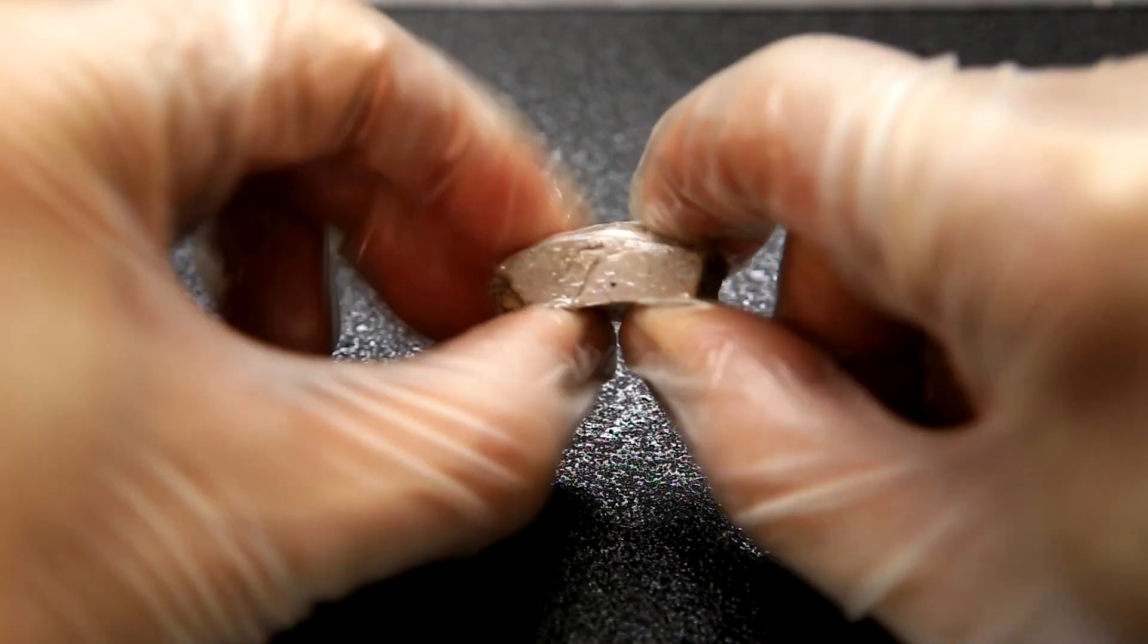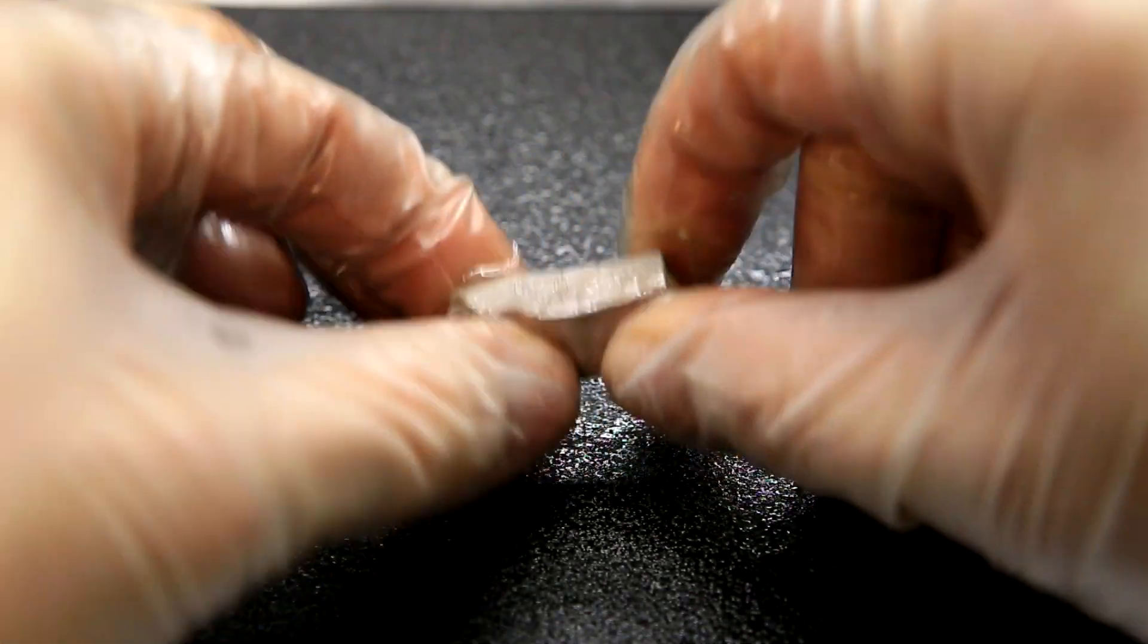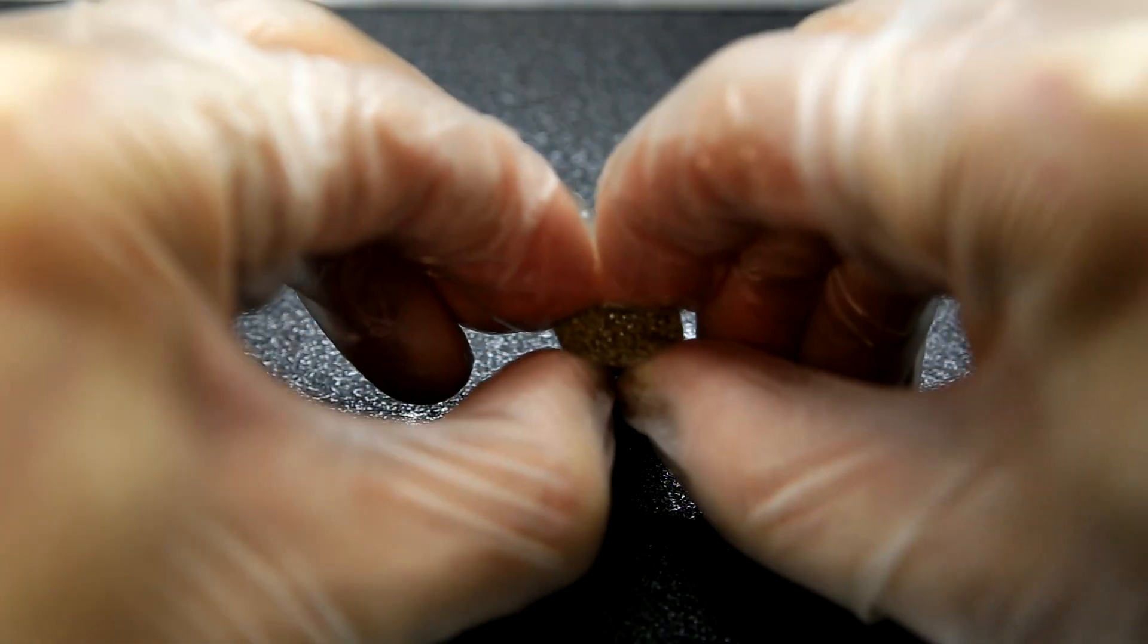Here we have a small piece of sodium metal which you can see is quite malleable and easy to manipulate. It's very easy to bend and even squish it just using your fingers.